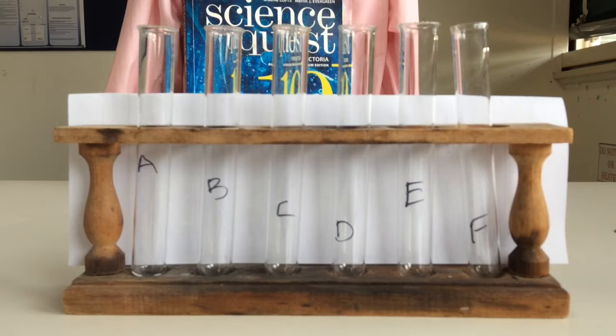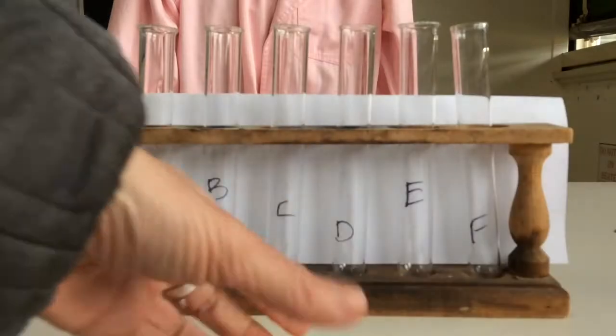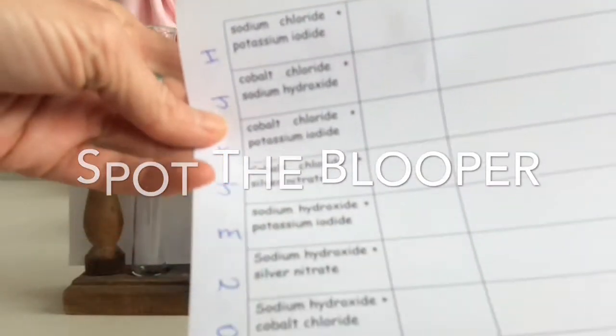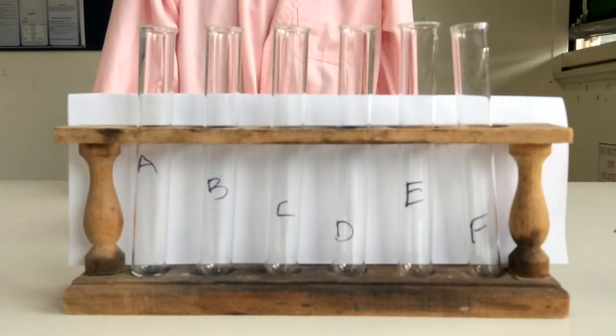Right, the other thing I've done to try and make it a little bit easier for you guys is I wrote the alphabet out along the results table. So just down along the side, I've started at the top, A, B, C, D, E, F, G, went all the way around. I haven't set up the back part of it yet, but just follow the alphabet through, okay? Okay, so the first five have all got copper sulfate in them.